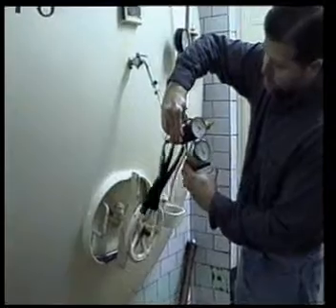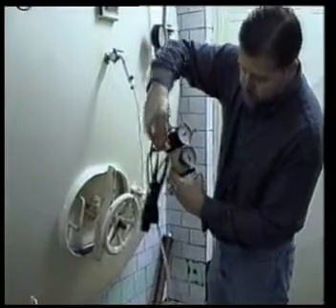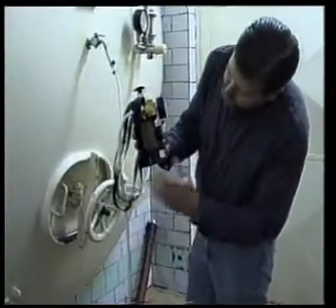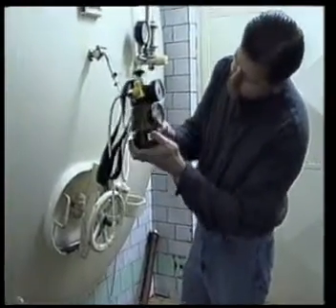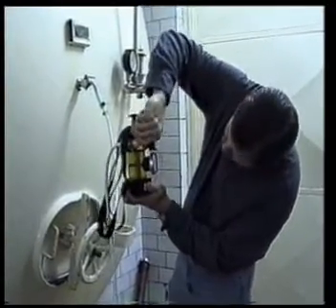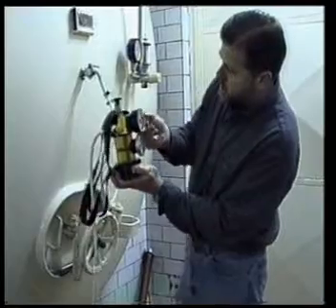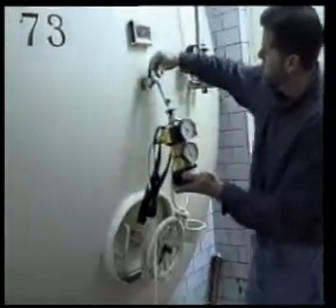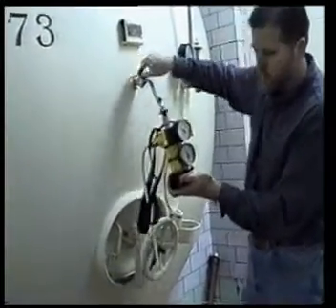Open the output valve a little bit to release the pressure and get the beer flowing. Notice it fills up; the goal is for it to be clear so there's no foam in the chamber. Once it's clear, close it, then shut the input side, and then shut the valve on the tank.